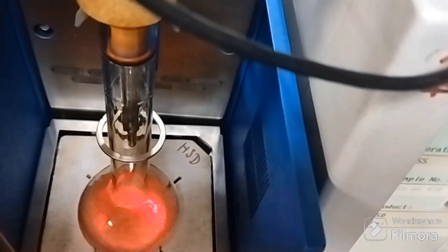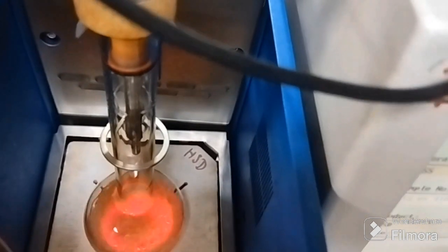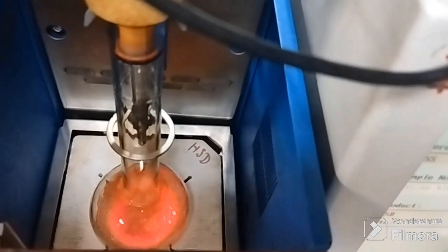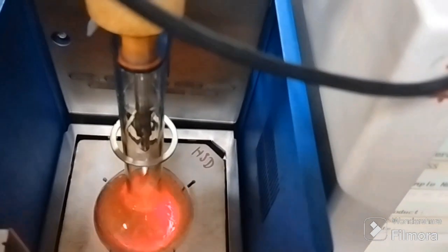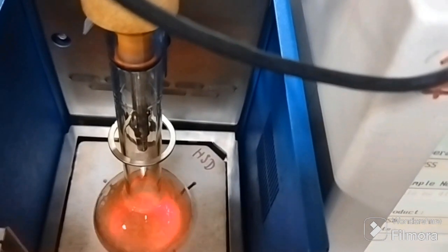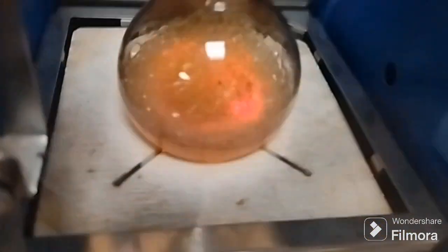Right now at this angle I'm inclining my cell phone so that you can see that red portion is basically the heater flame being given to this flask, right? And in the middle above, you have this PT100 temperature probe inserted inside at the center of the distillation flask neck.